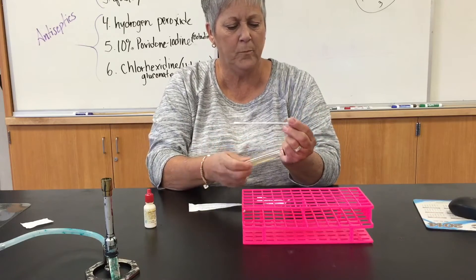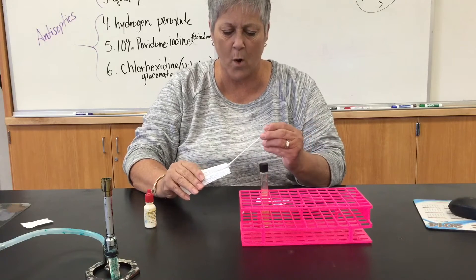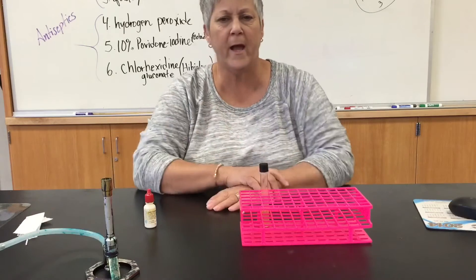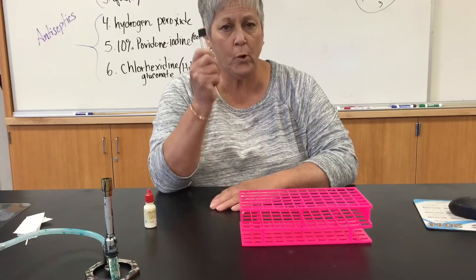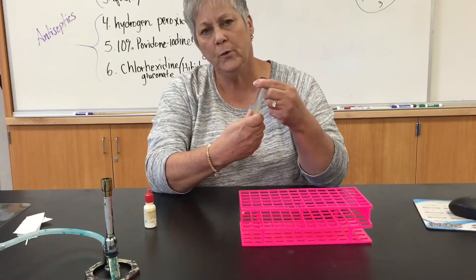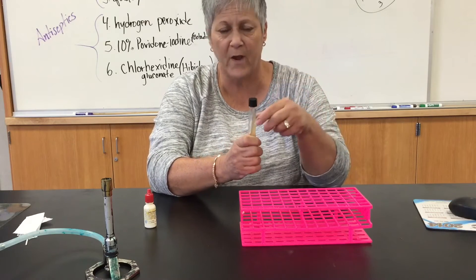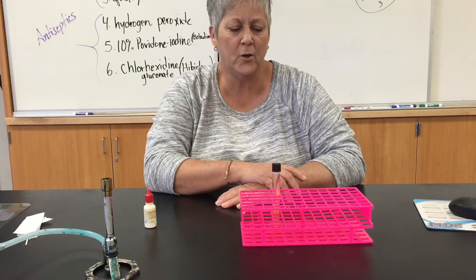I'd recap my tube, and of course this swab, which is not contaminated because I'm just play-acting here, would go in the biohaz can. Before you incubate, put your cap back on and then loosen the cap about a quarter of a turn. You don't want the cap so loose that it's falling off, but you want a little bit of air to be able to get in there. Then you would incubate this as recommended in your lab manual.